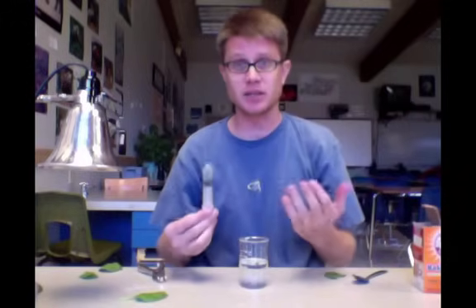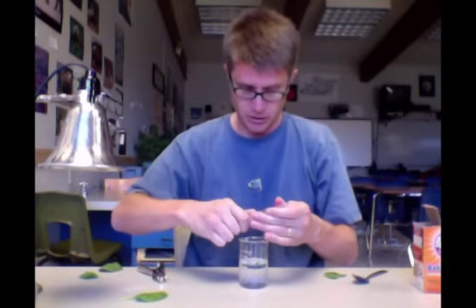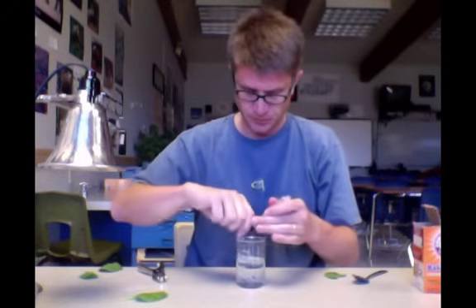Now I want to put this in my test beaker. To do that I'm going to pull it out the bottom and they're going to sink down to the bottom. I could cover this up and keep it in the dark and I could get a bunch of these ready to do a number of trials. But I'm just doing this as a demonstration.